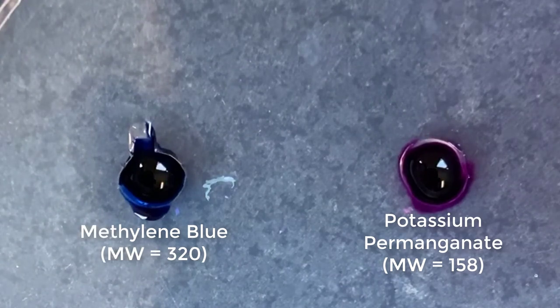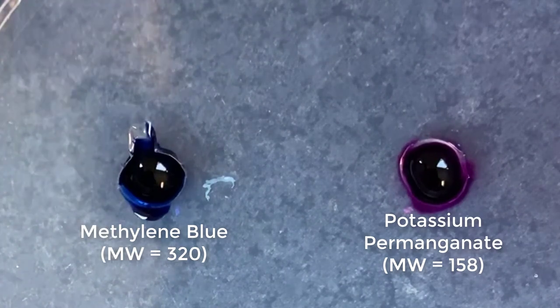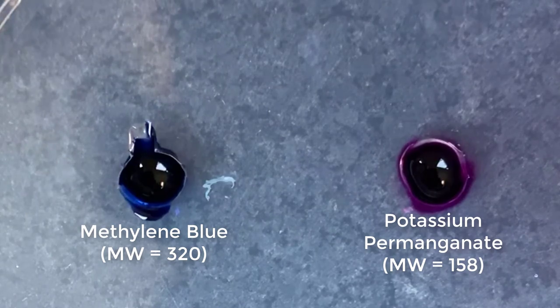We're going to prepare another dish like this that's going to sit on ice. This one's going to stay at room temperature, and we're going to wait one hour.